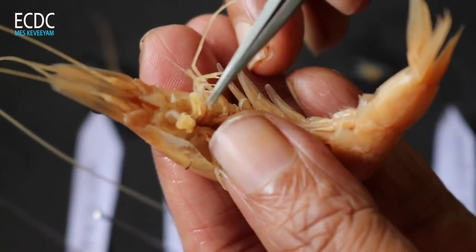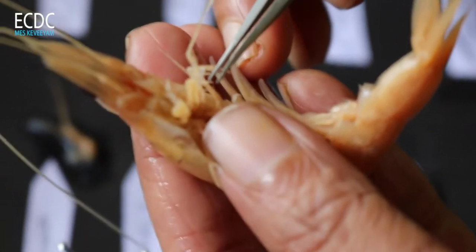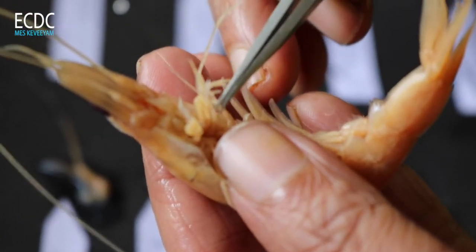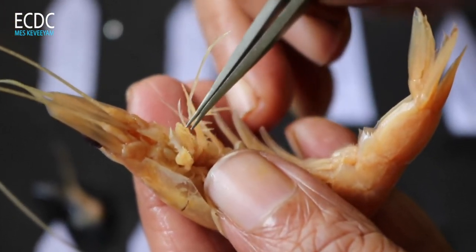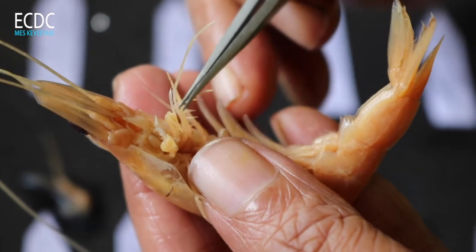This is the second maxillipedes identification feature. This is the interrogation mark shape.